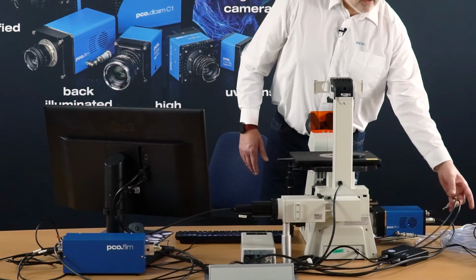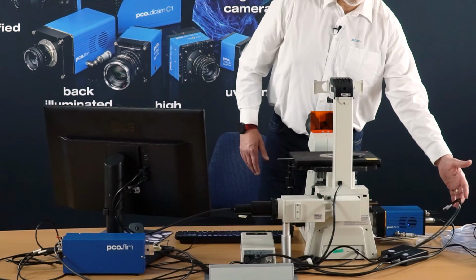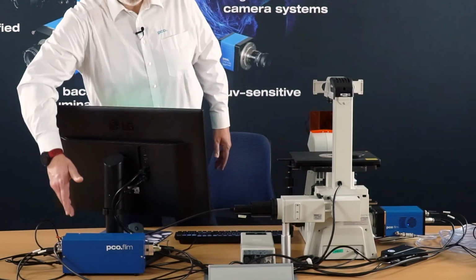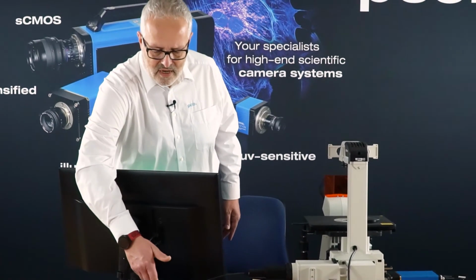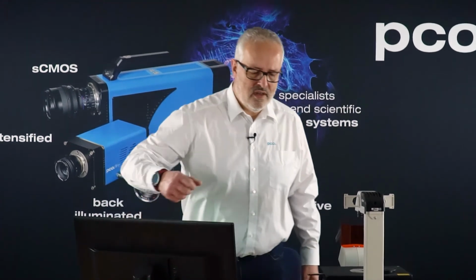The camera is connected with the modulation and the dark gate signal to the light source. Since we are going for nanosecond lifetimes, we are using today a laser for the wide field illumination of the microscope. The laser itself is coupled into a liquid light guide, while the light has to pass a diffuser to reduce the amount of speckles that would be caused by the coherent light of the laser. With this setup, that's all you need to do nanosecond lifetime images.